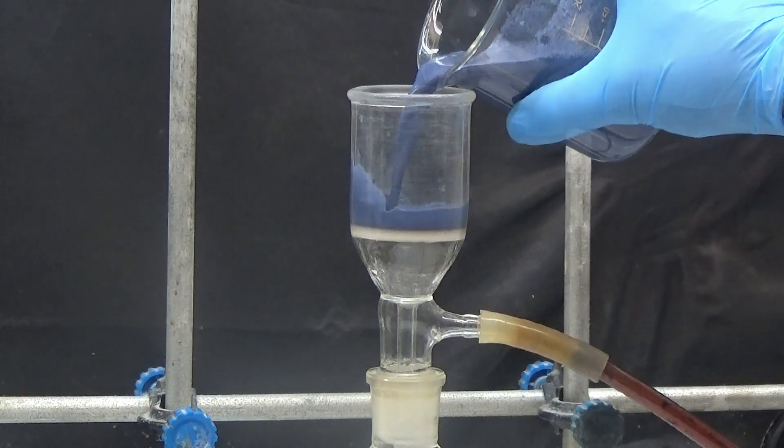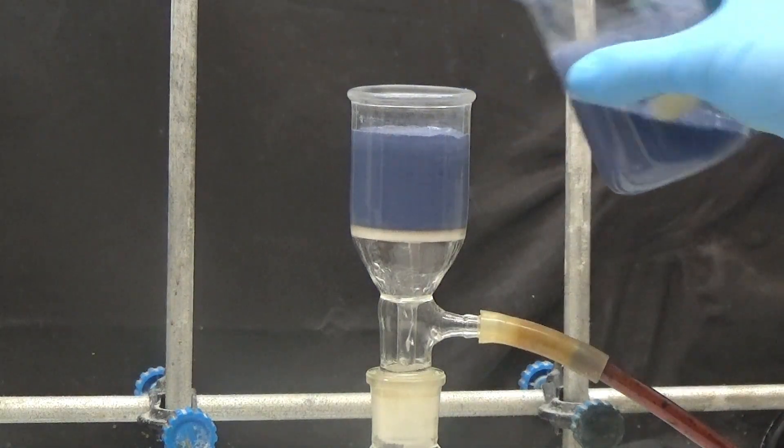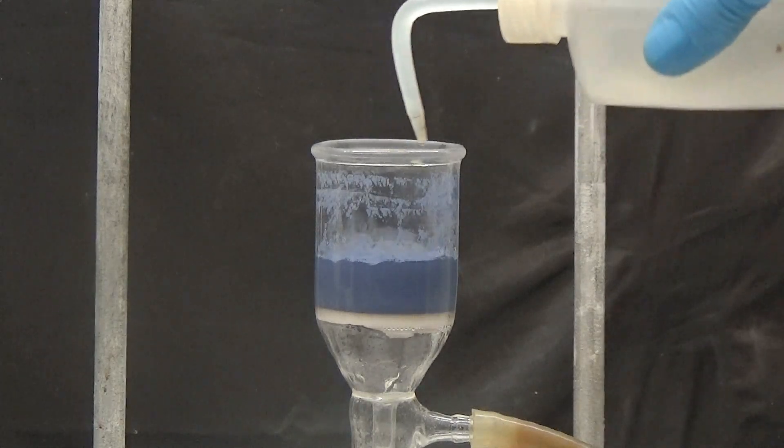Collect the precipitate by suction and wash twice with cold water.